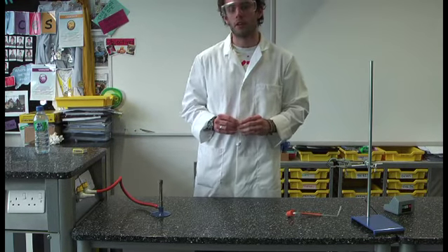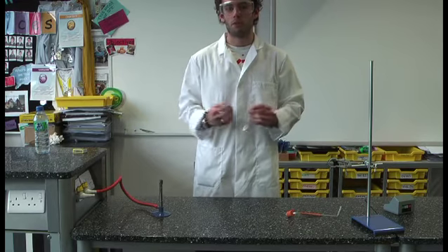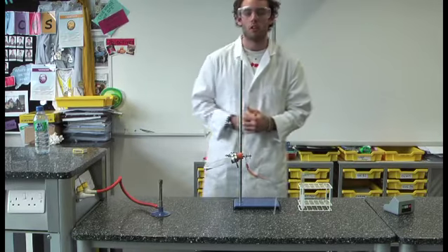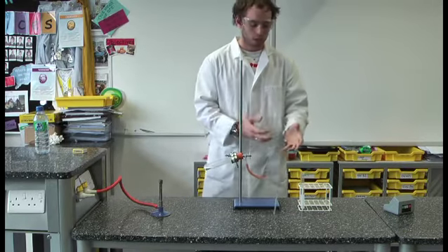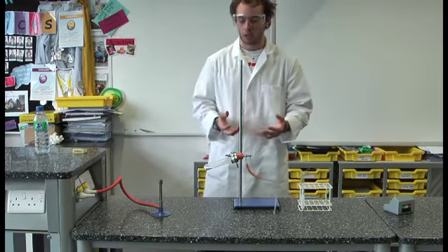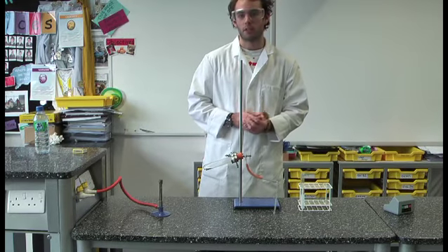Now this resulting weight is very important as it will allow us to calculate the loss of mass of the metal carbonate through thermal decomposition. Given that the chemical structure of magnesium carbonate and the cloudiness or discolouration of our lime water can tell us that we've produced CO2, we can clarify that the product after this thermal decomposition is magnesium oxide.